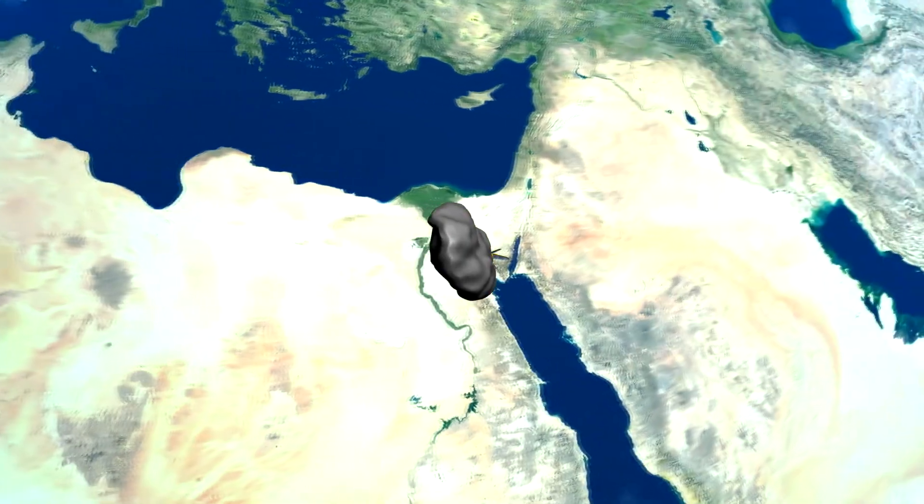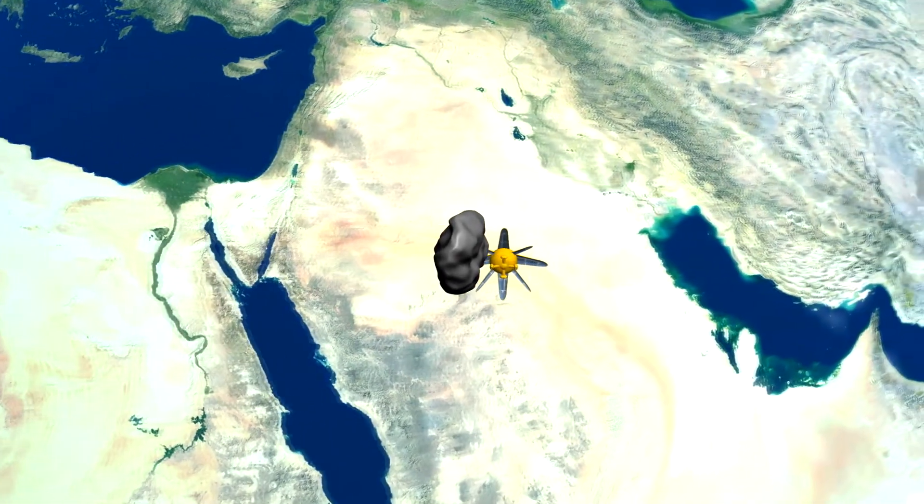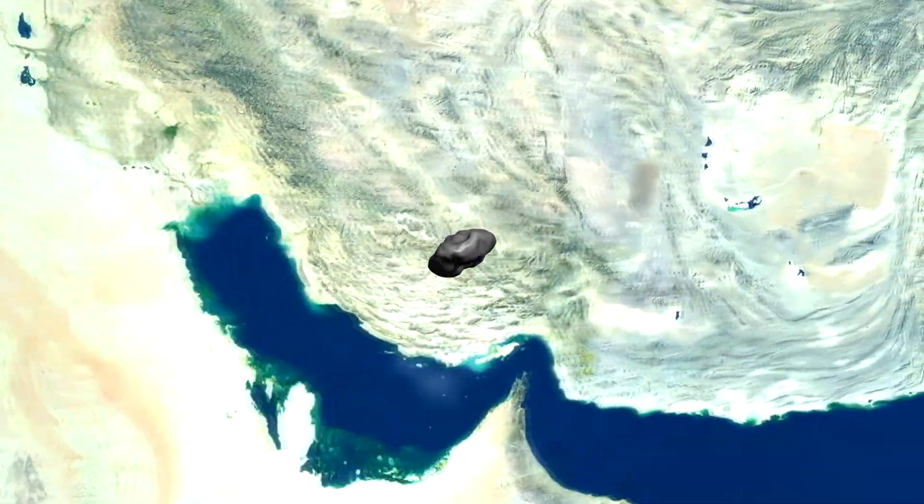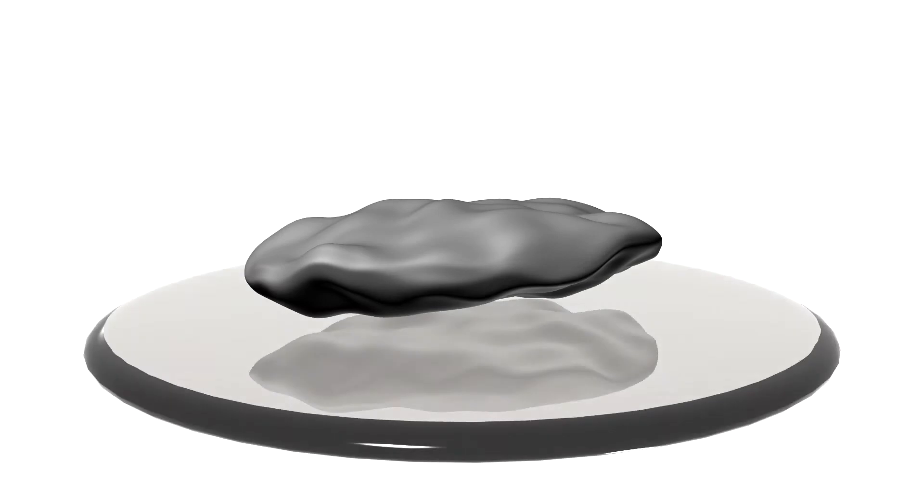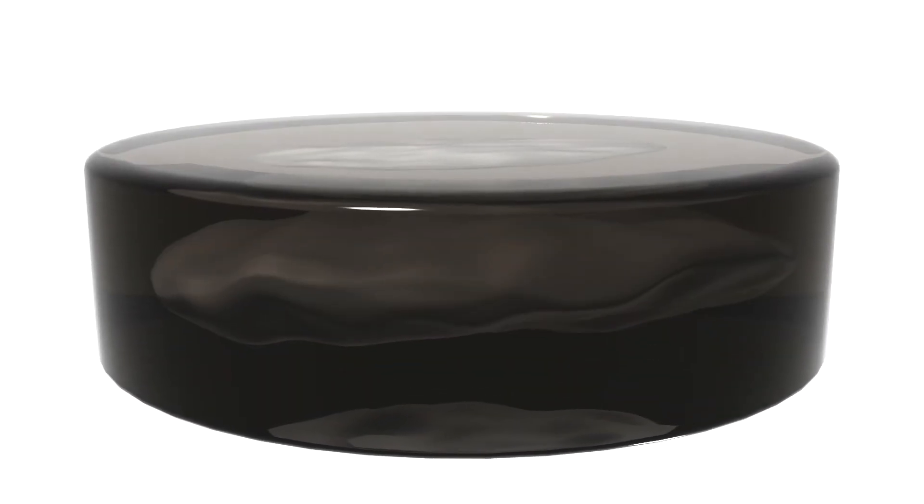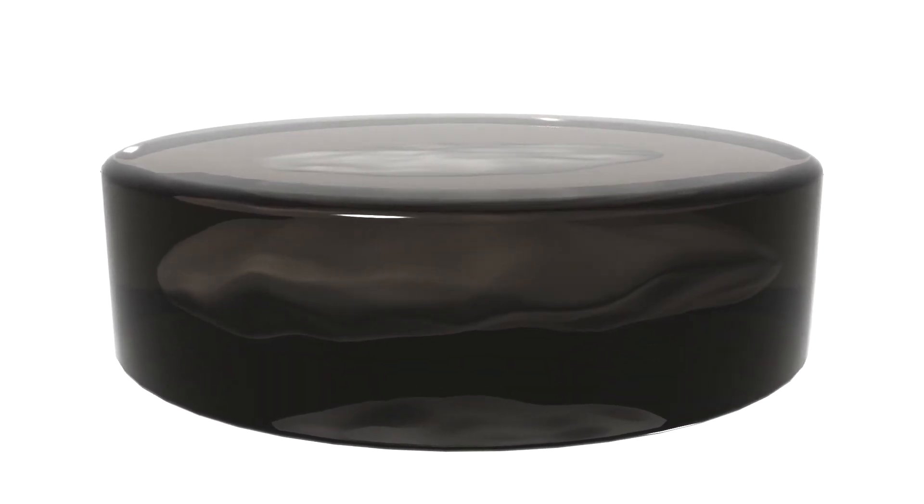How do we measure the composition of the sample? For that purpose, we need to study the interior of the meteorite, which was not oxidized or otherwise contaminated during the atmospheric entry. This can be done by drowning the sample in vacuum epoxy and cutting it precisely to expose its interior.